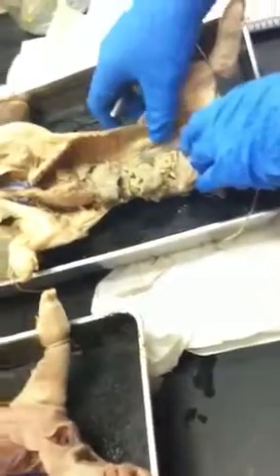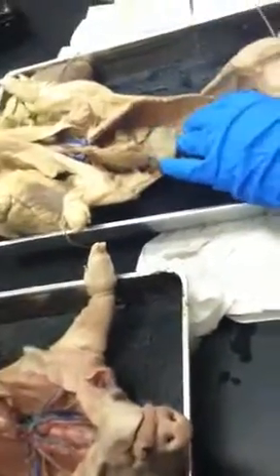Can you point out these again? Sorry. Bing, bink. Bing, bink. Okay. And then this one, bing, and then you go down farther about a centimeter, and then it's off. All right.